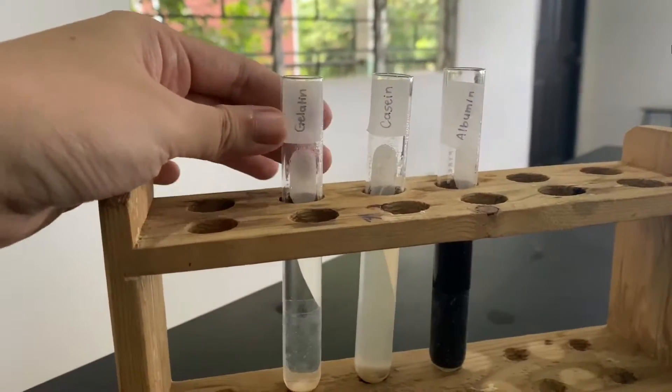After the solutions were taken out of the water bath and allowed to cool down, these are the results.